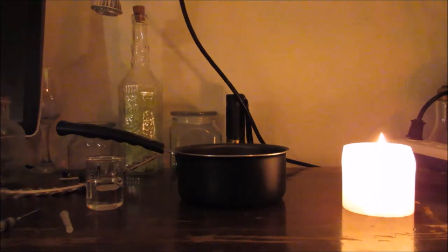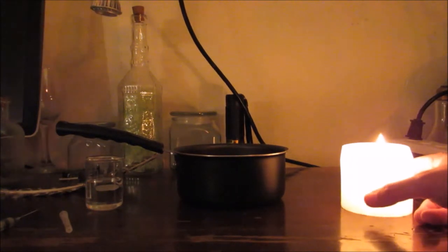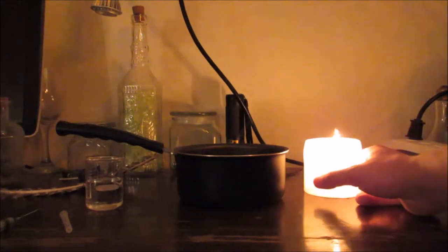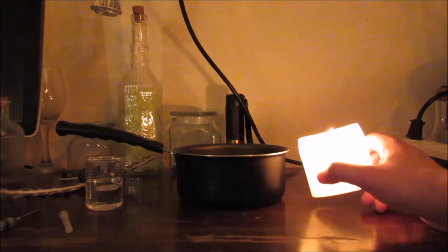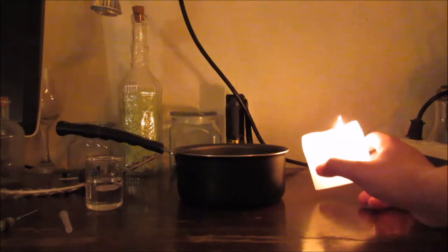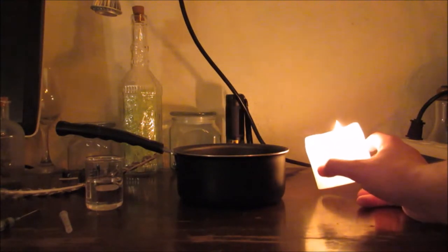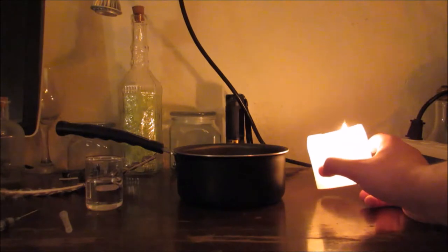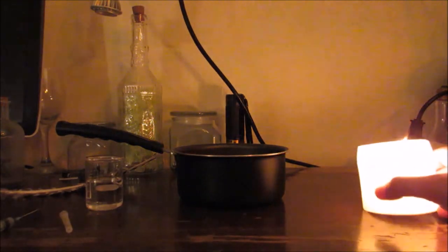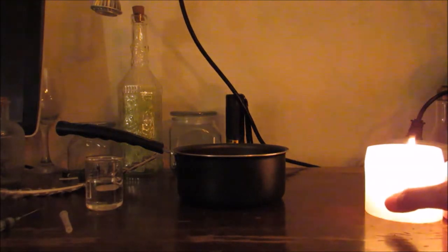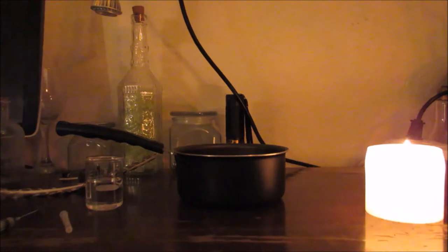My, my. I might have had my math off a bit there. That wasn't very endo. But as you can see, it is smoldering quite a bit. Still warm in fact.